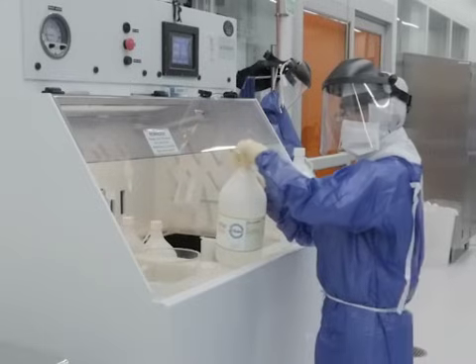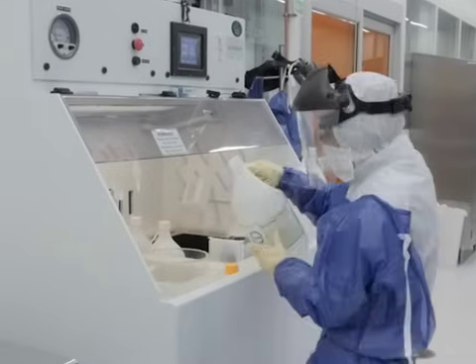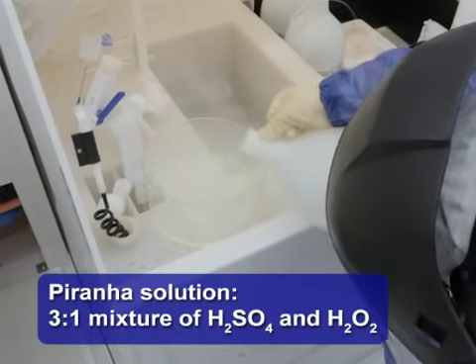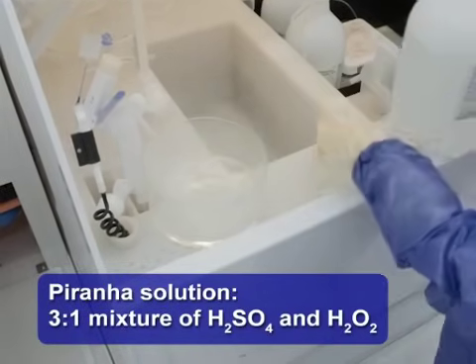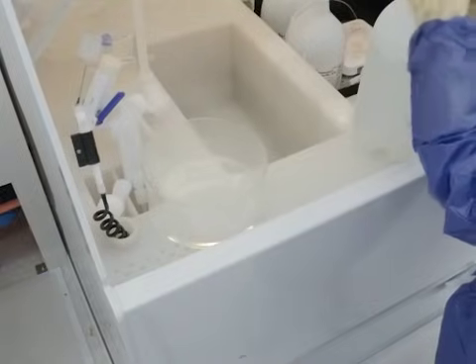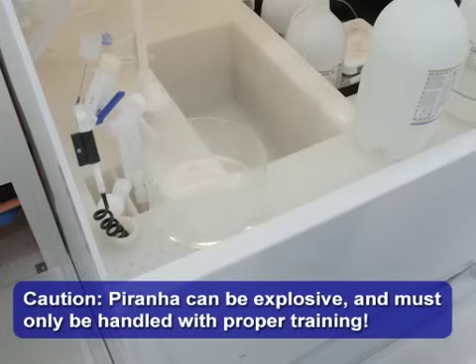Next, a Piranha cleaning solution is prepared to remove excess organic residues. Piranha is a mixture of concentrated sulfuric acid and hydrogen peroxide. This solution must be used in an approved well-ventilated hood with proper training. Piranha is extremely dangerous and can be explosive.